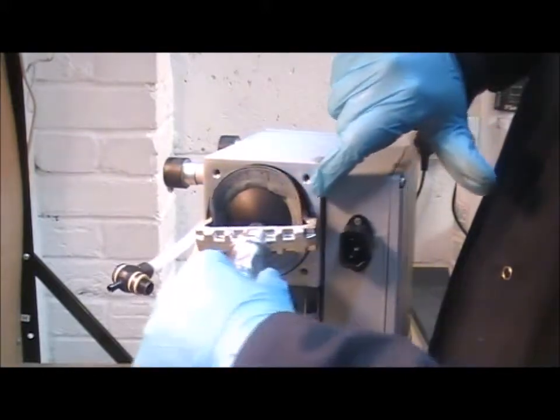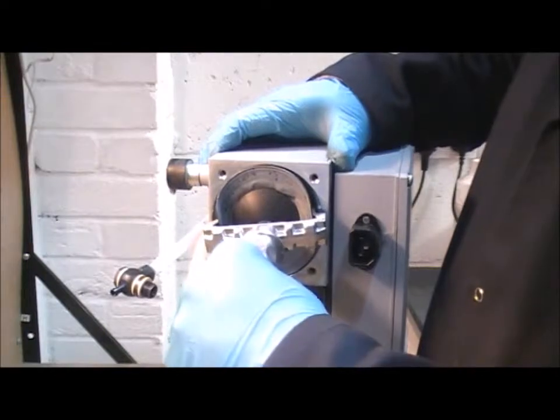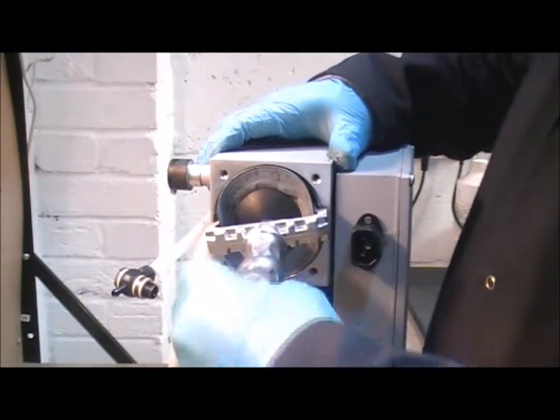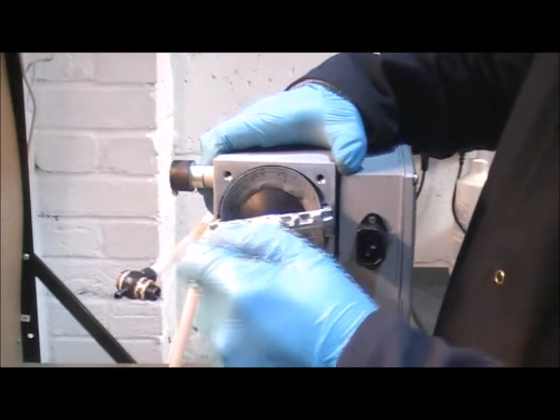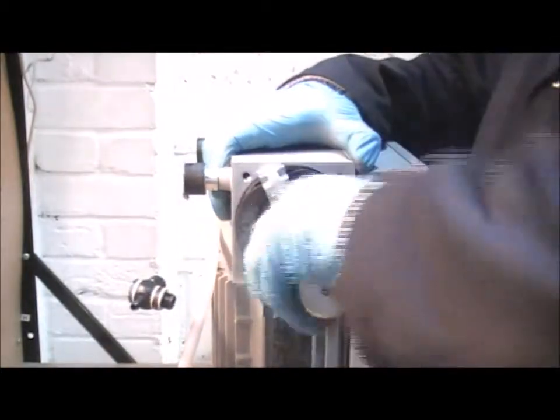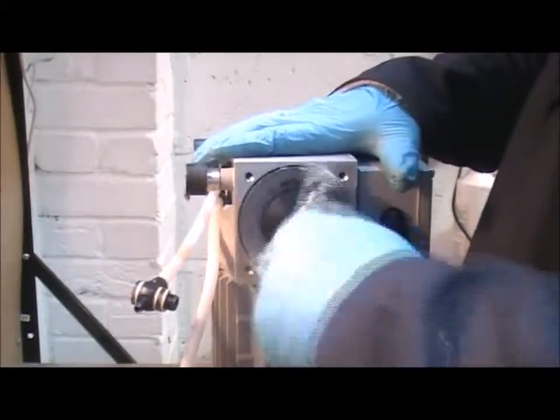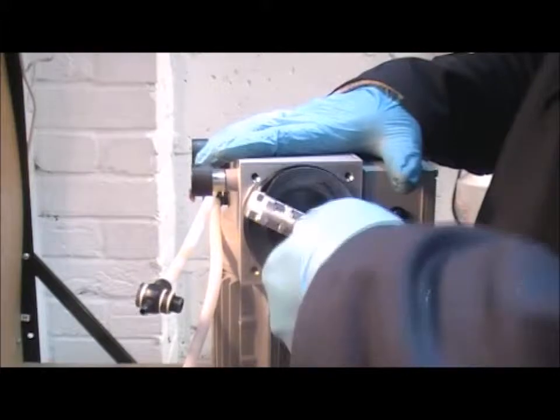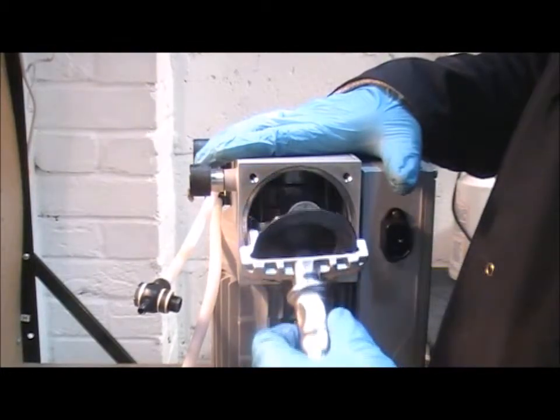Then you can look in from the side here, and down here, you'll see it a bit more clearly in a moment, I can see that there are flats on the plate behind the diaphragm. I've just got to rotate the tool until it catches those two flats. Now it's nice and secure, I can go ahead and unscrew the whole assembly using that tool. And when it comes away, just lift the whole lot down.